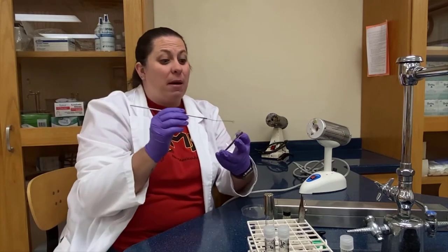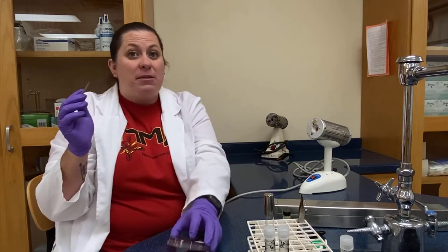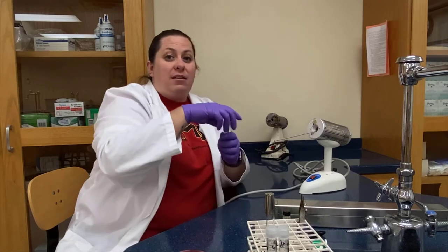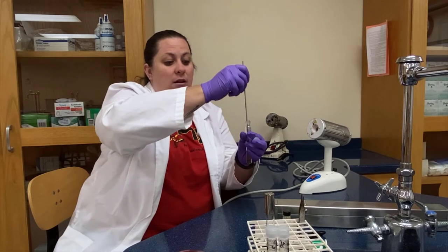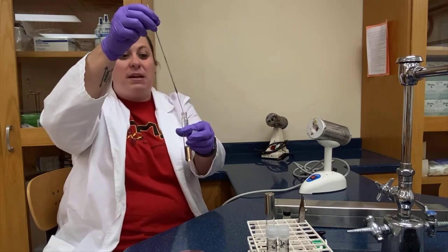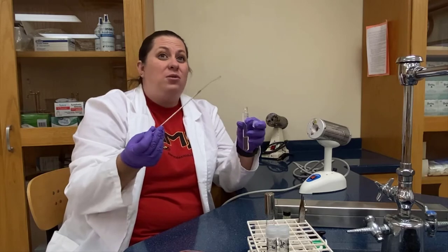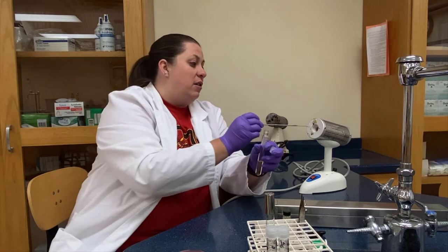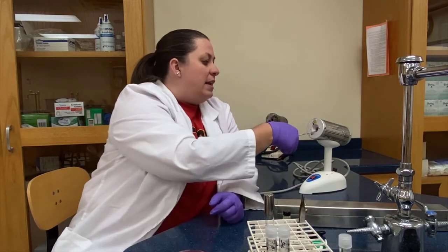We're also not going to cool the loop by putting it on the edge of the plate. Another incorrect method some people try is sticking the hot loop into the broth to let it cool — you can hear the sizzling as it cools, but if there's already bacteria in there, it's going to be killed or harmed by that heat. So we don't want to do that either.